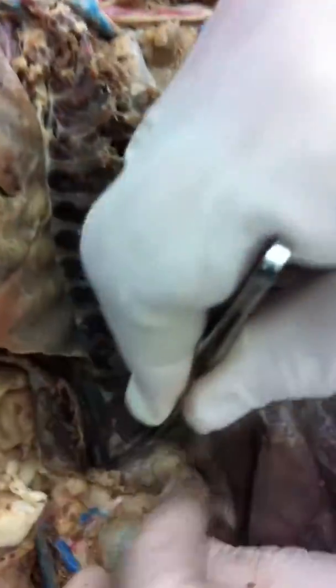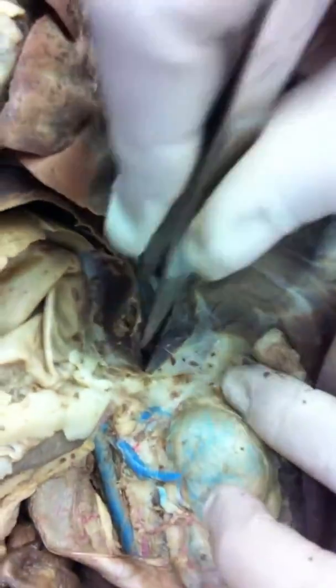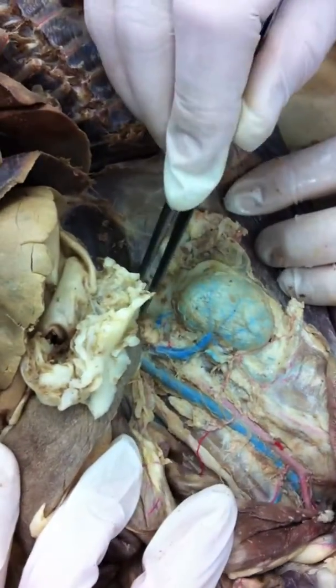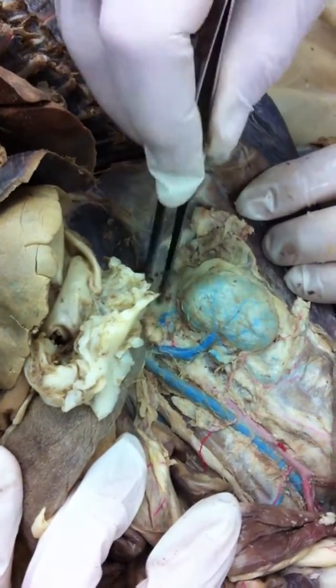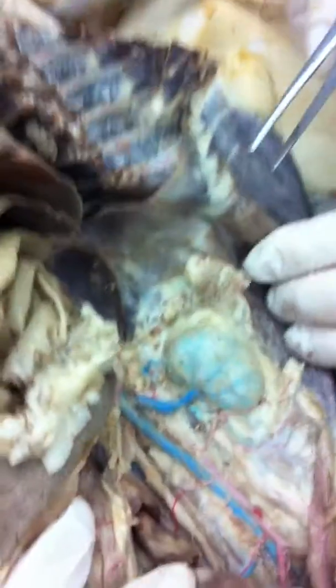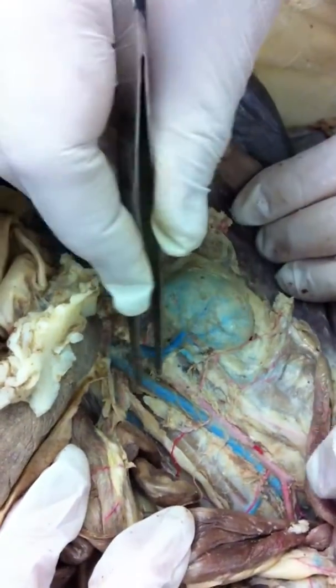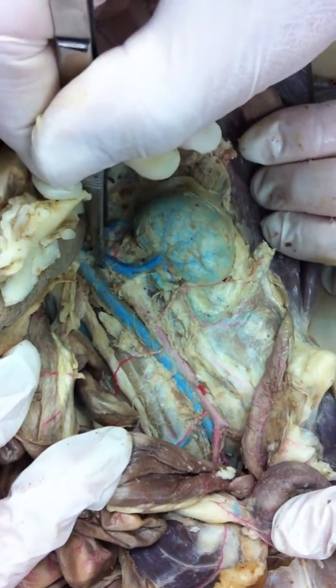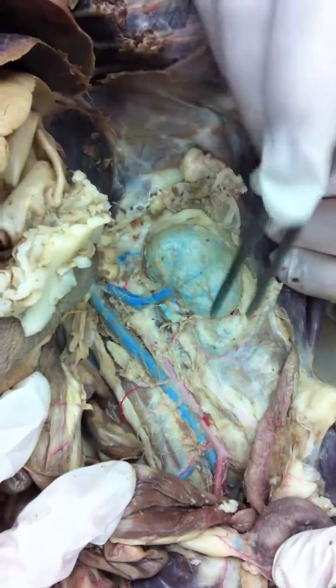But what's my problem now? Looks like you run into... I want to keep this going. So, what I'm going to do is hunt around just down here for just a moment, if y'all humor me, and see what we got down here before I start doing some more damage than I've already done. We've got all this fat. We've got to do something to get a look. I know what this is. That's post cava, and I know that's a renal vein. Could we all agree to that?